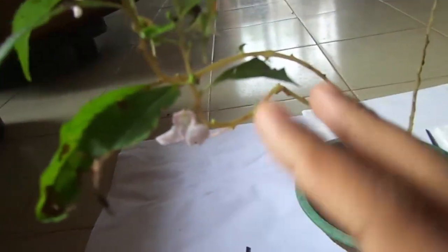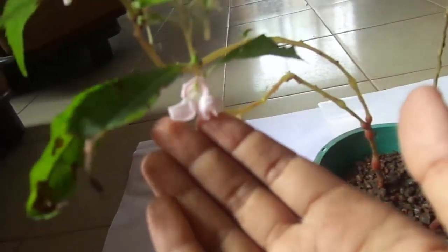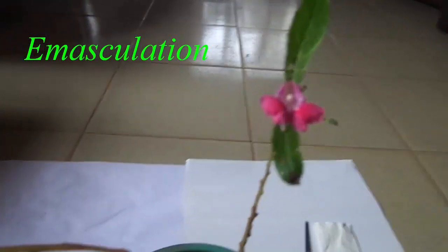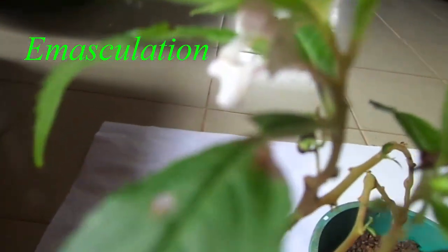In simple terms, what's going to be done is to take pollen from the pink color flower and apply them on the stigma of the white color flower. As our first step, after selecting the parents, we are going to do the emasculation.